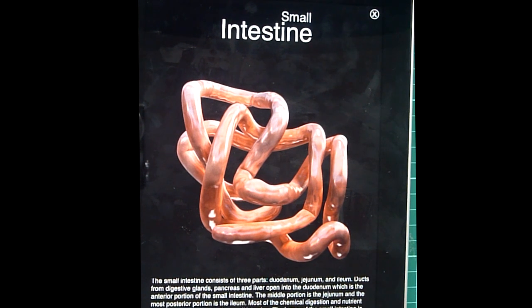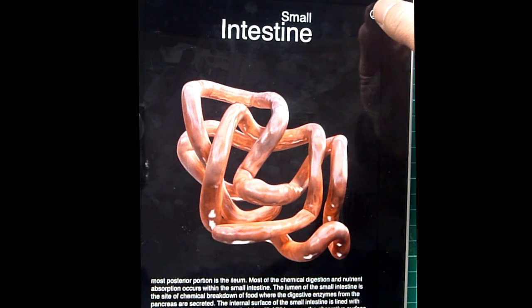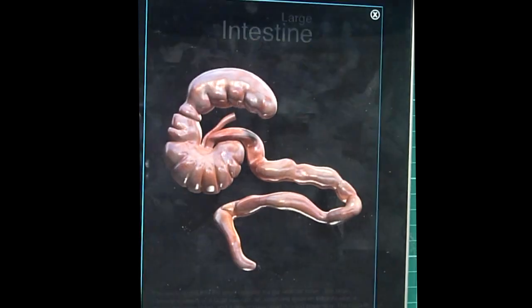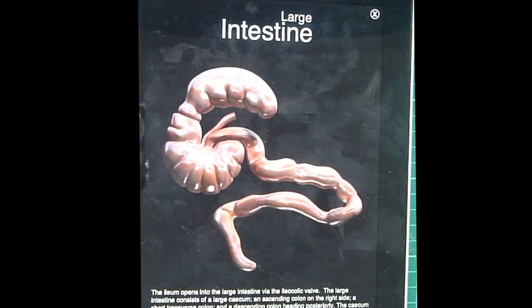The lumen of the small intestine is the site of chemical breakdown of food, where the digestive enzymes from the pancreas are secreted. The internal surface of the small intestine is lined with numerous minute projections called the villi. Villi increase the absorptive surface of the small intestine. The ileum opens into the large intestine via the ileocolic valve.